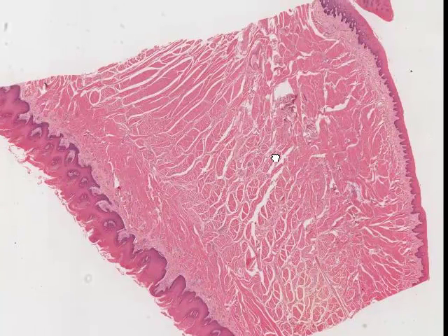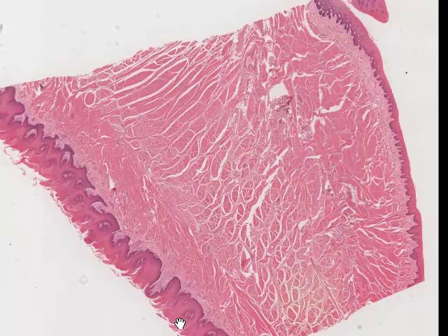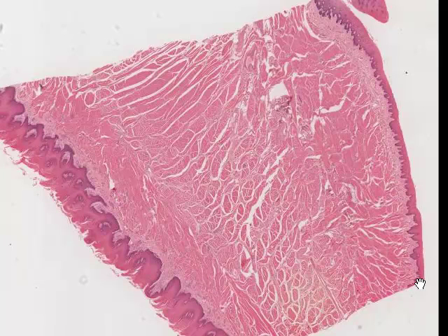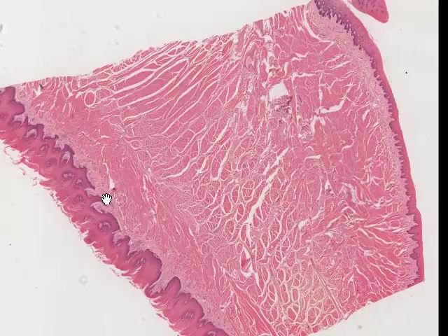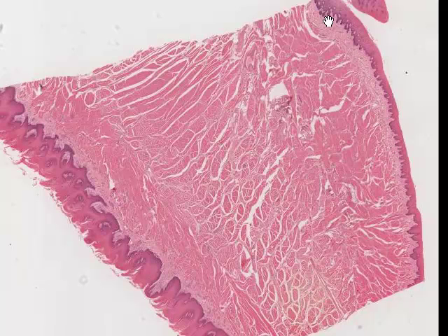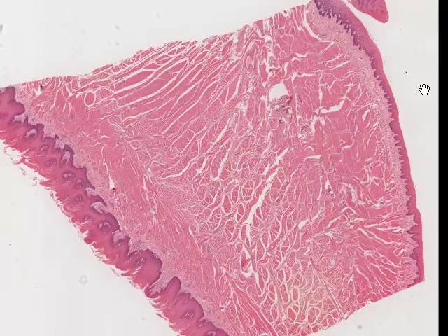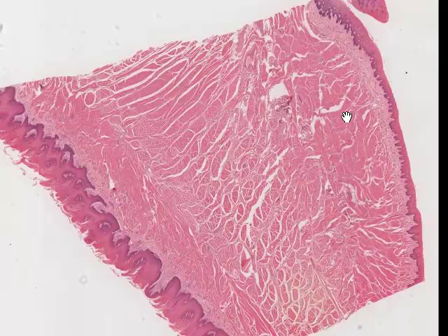This is a slide with which you should be familiar, because this is another section through lip. We have an epithelial surface here, and you should revise what epithelium you can see by looking at it. Beneath the epithelium on both surfaces is some connective tissue — in fact, a couple of types. The bulk of the core of the lip that we can see here is made up, at least in this section, with muscle.